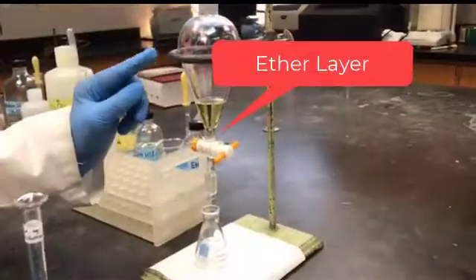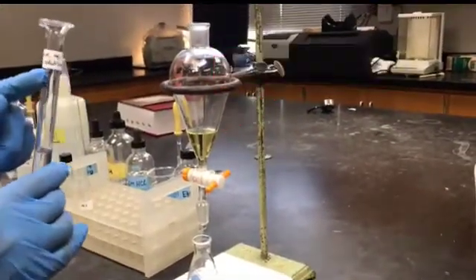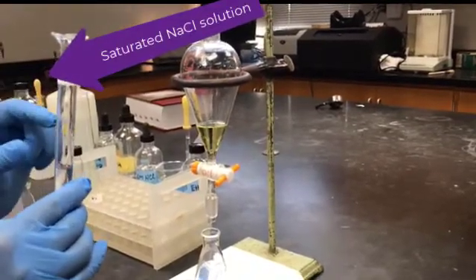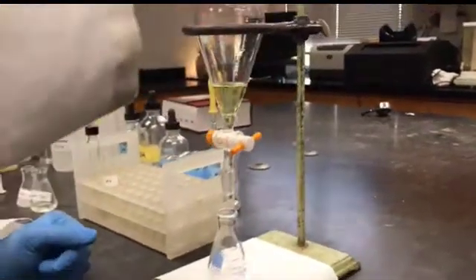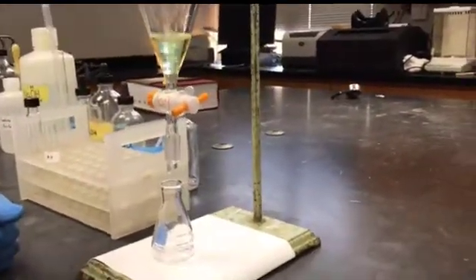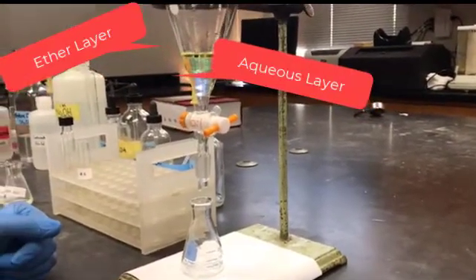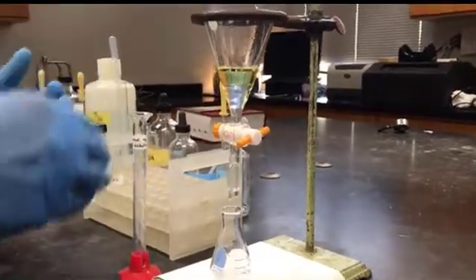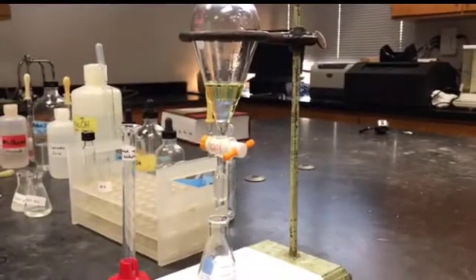Now the separatory funnel contains only the ether layer. I'm going to add 5 milliliters of saturated sodium chloride solution, which is also called brine solution. The purpose of this solution is to remove the remaining water from the ether layer. So I'm again going to shake the funnel, let it sit, separate out the lower layer, and this time I'm going to discard the lower layer.